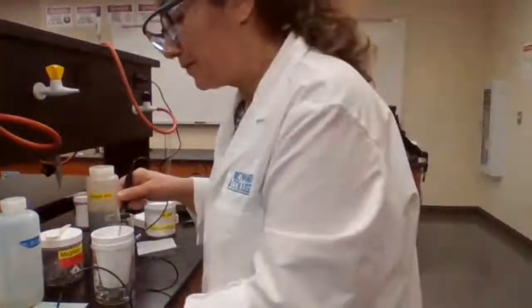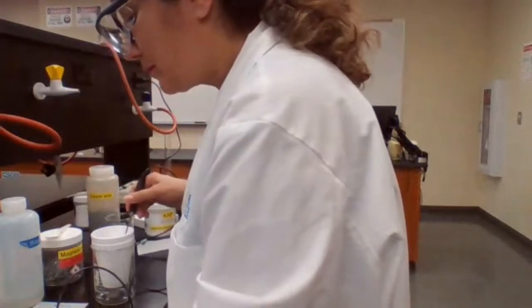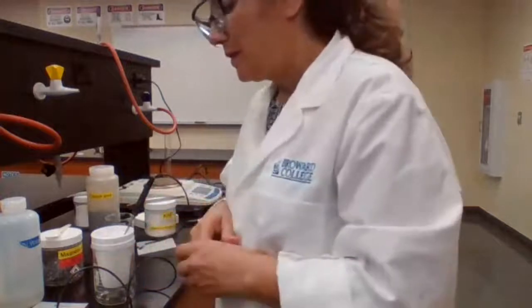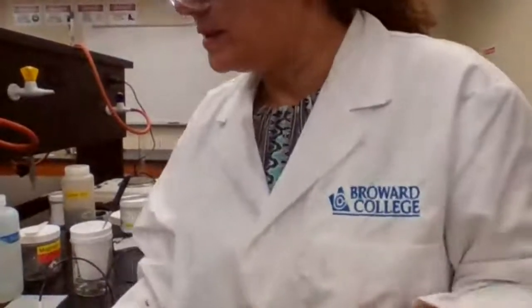Okay. .4. Okay. I think that's all the data you need.